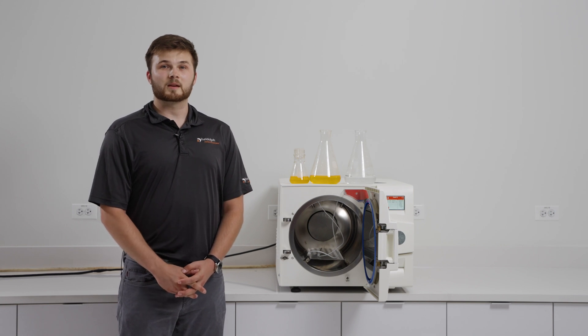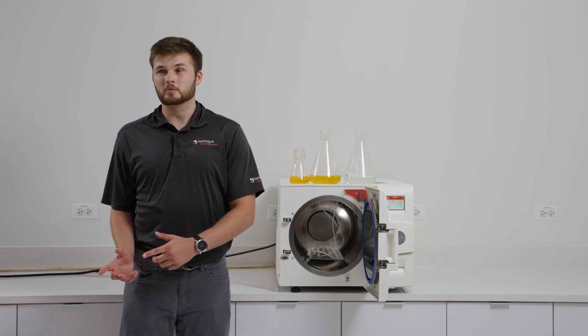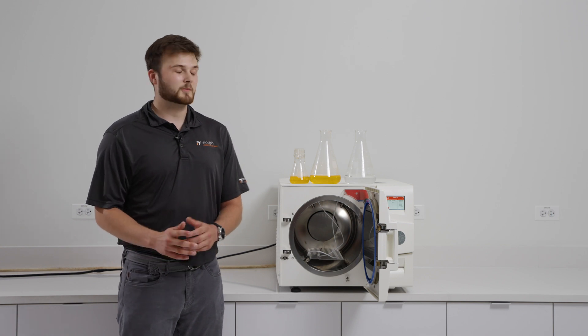This control vessel needs to be filled with the same amount of water as the vessel with the maximum amount of your media in it. Let me show you what I mean.